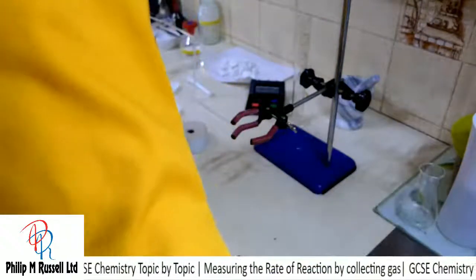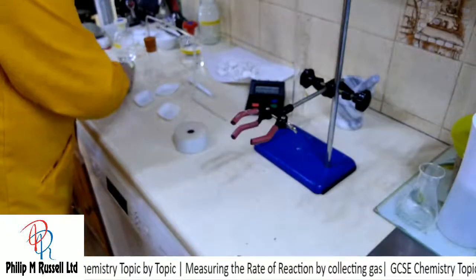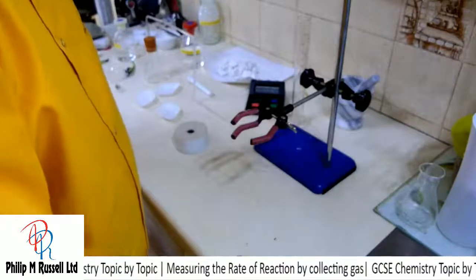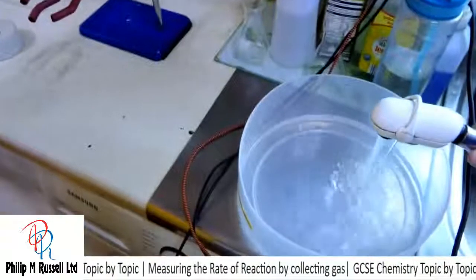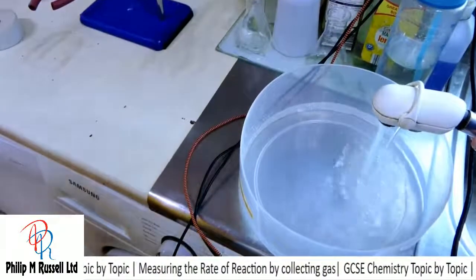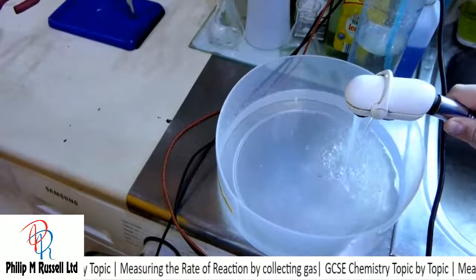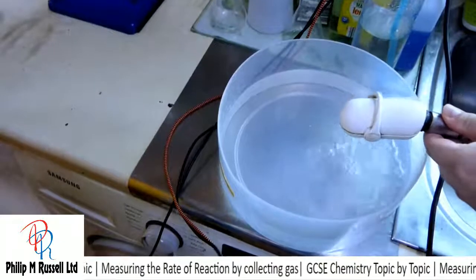Oh, just stand it on there. We're lucky that what we've got here is a tap that we can then use to fill this without having to move it.